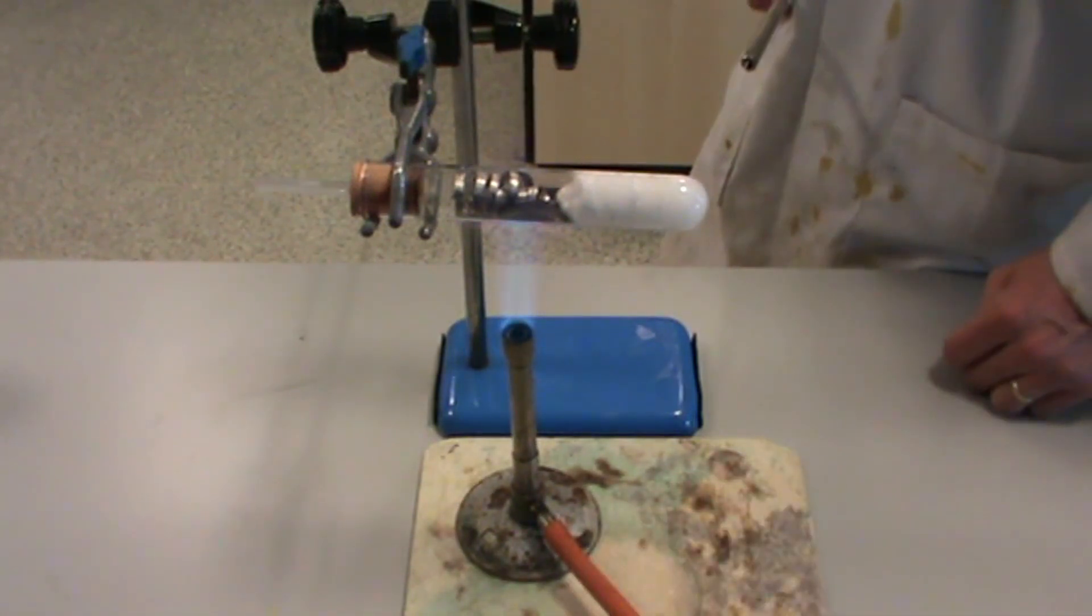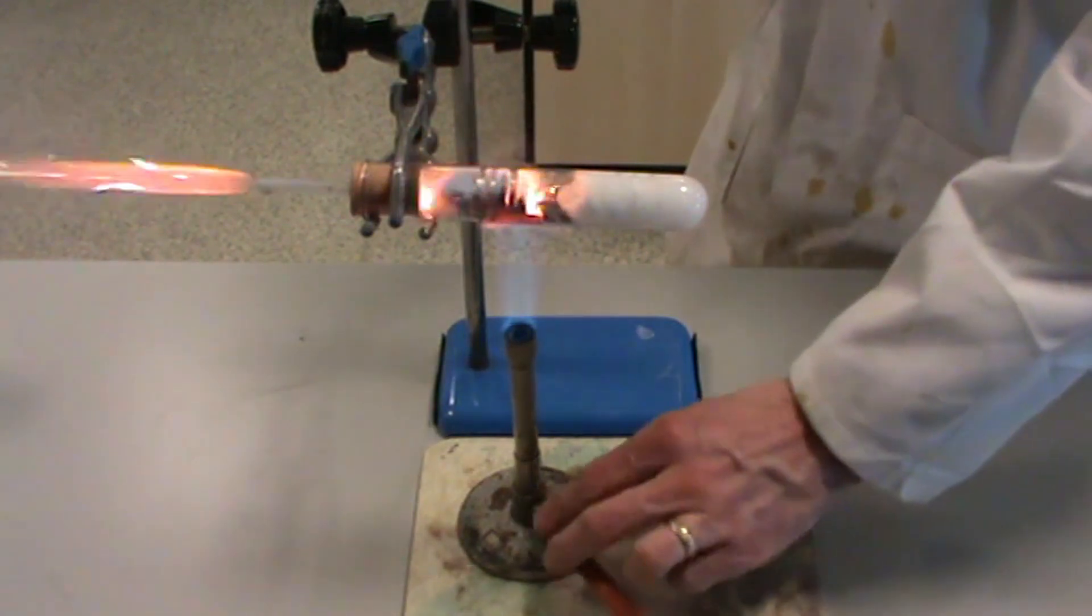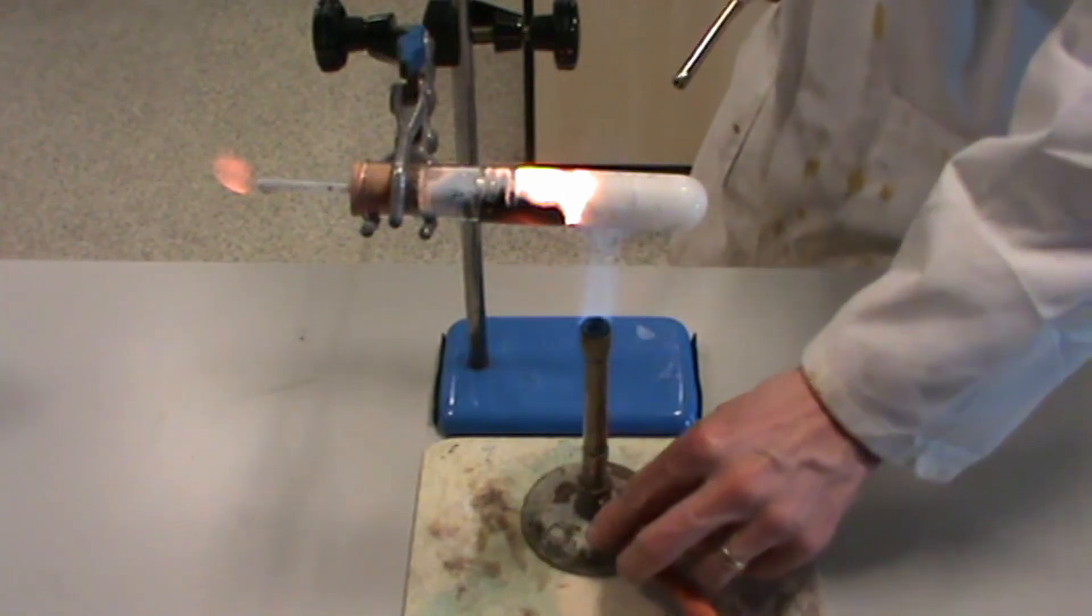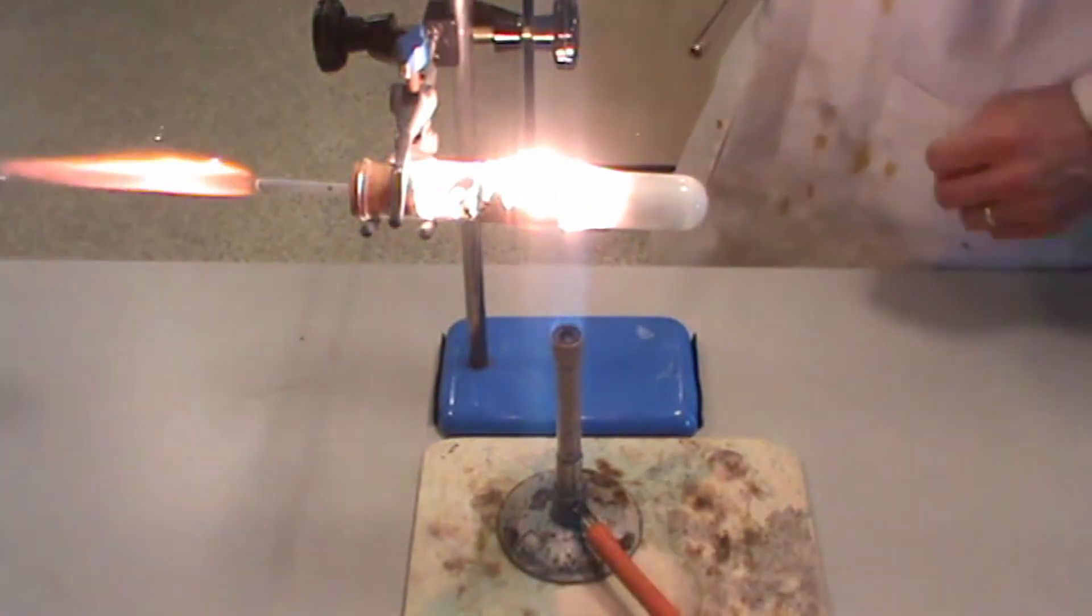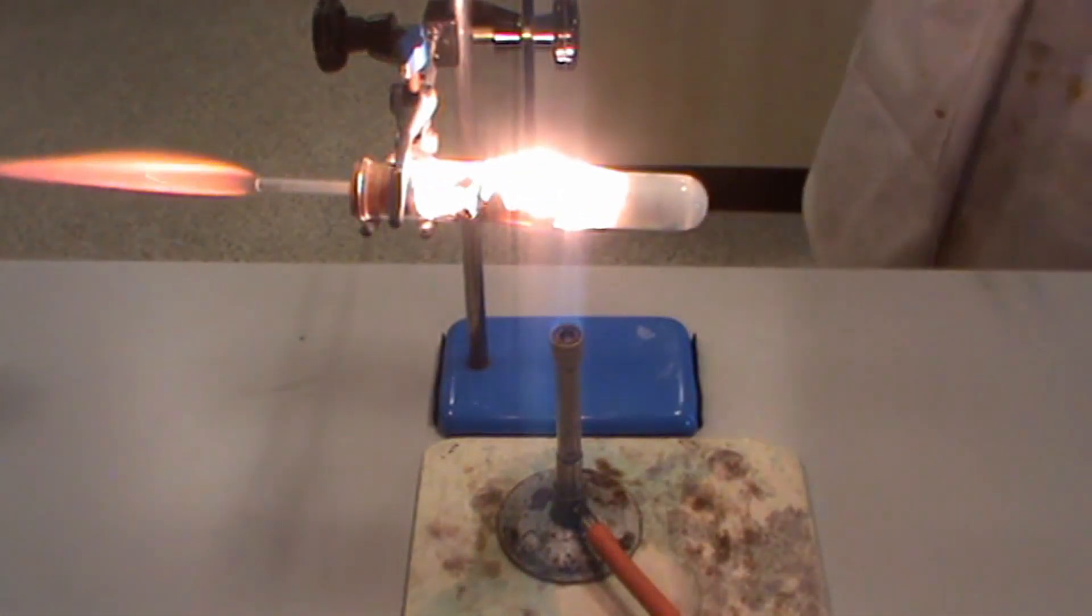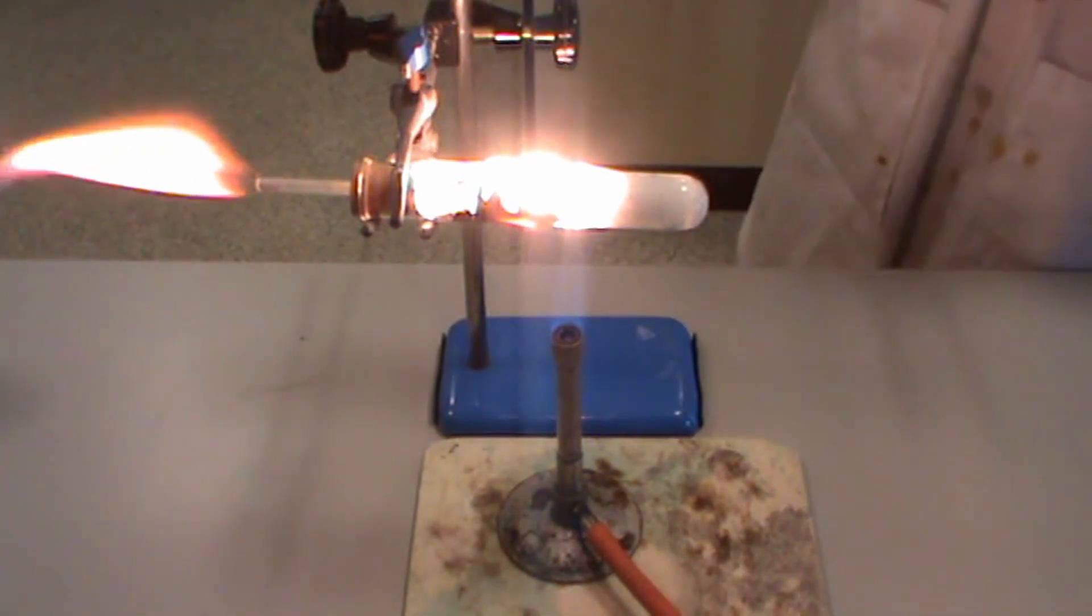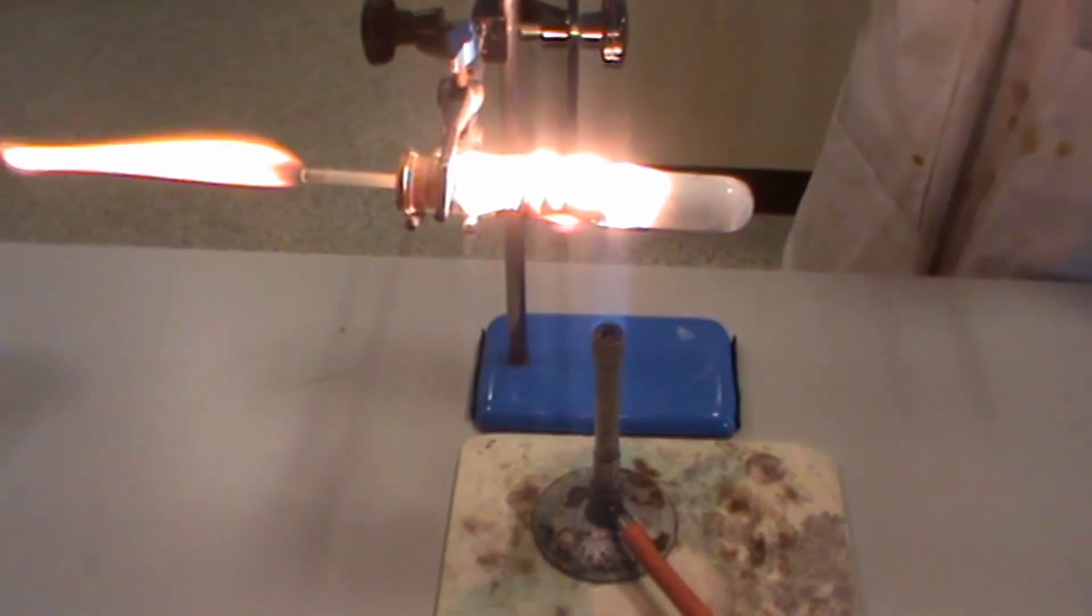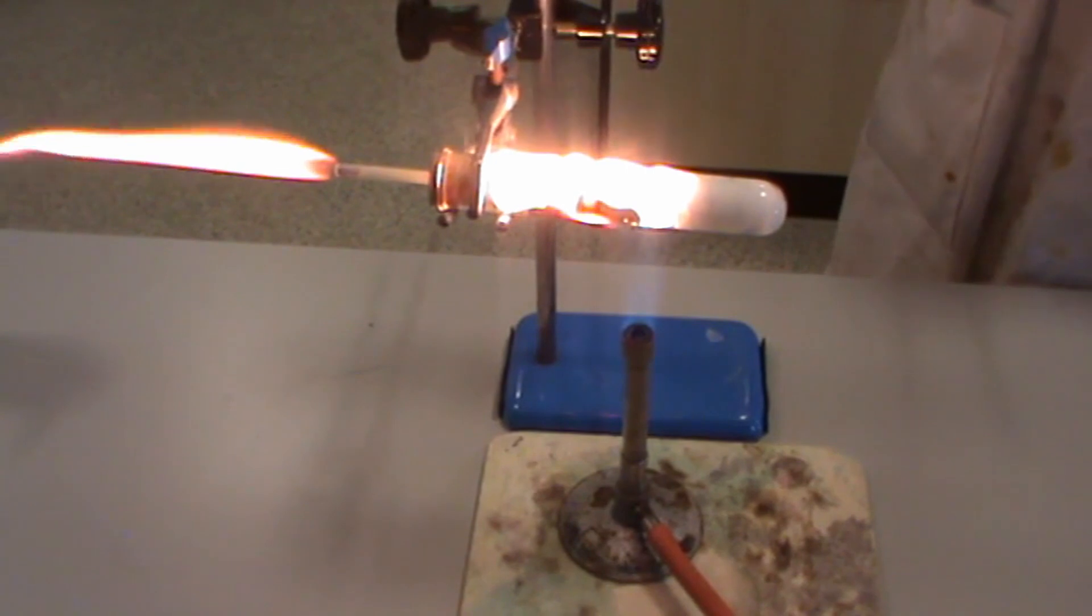You may be able to see some steam. The sparks are magnesium powder leaving the boiling tube along with the hydrogen gas.